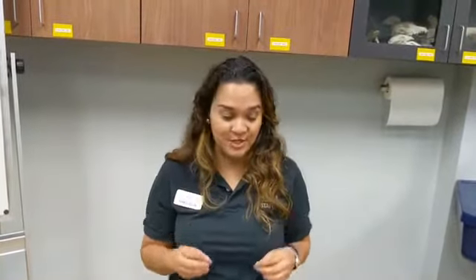All right, so we have a good qualitative test that we did. So qualitative means that we're not really measuring anything. We're kind of looking at what color it is. So it doesn't really matter how much sample we have and how much indicator we put. I usually put about equal amounts so that you can see it. The next test we're going to do is quantitative. So we're actually going to measure. All right, so we're going to get some number results from these.